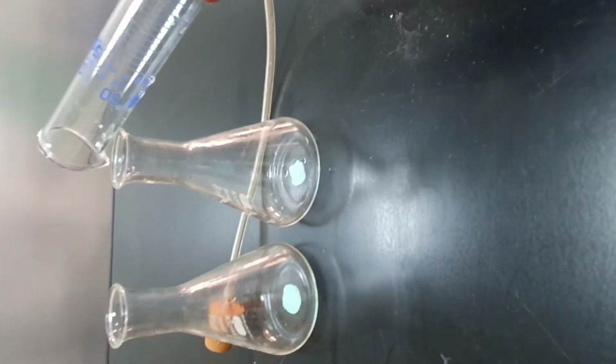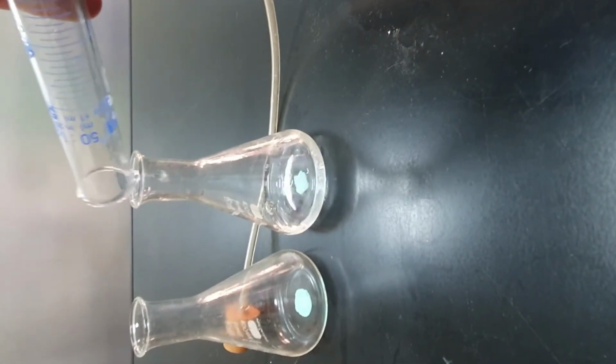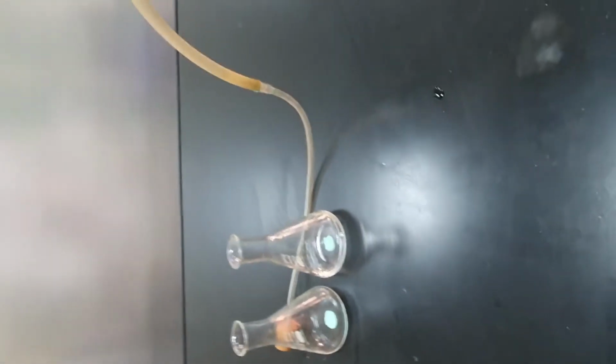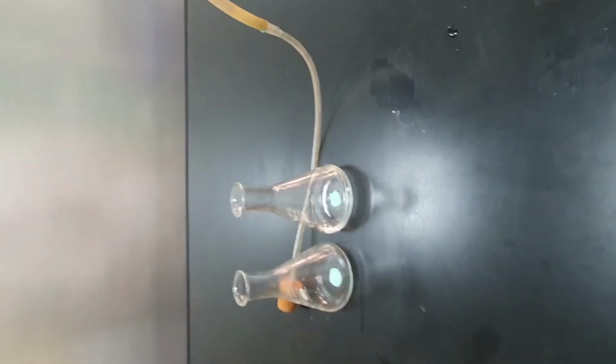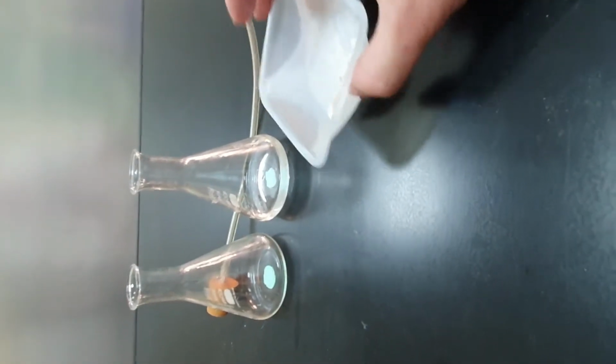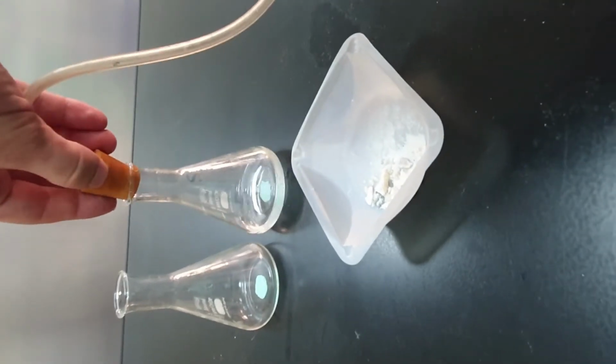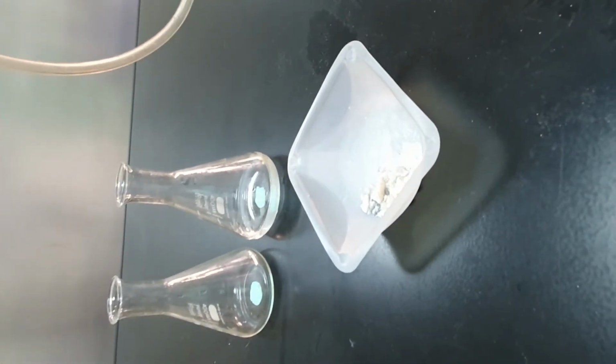Okay, so what I'm going to do is take the 1 molar acid and pour it into the conical flask, and then I'm going to simultaneously do 3 things, which is hard. I should have got a friend for this, but sadly maybe I've got no friends. I'm going to try to pour this calcium carbonate into here and then place this bung in the top so that instantly the delivery tube can start collecting that gas and it can go up into the gas syringe. That is my plan, that is my hope.